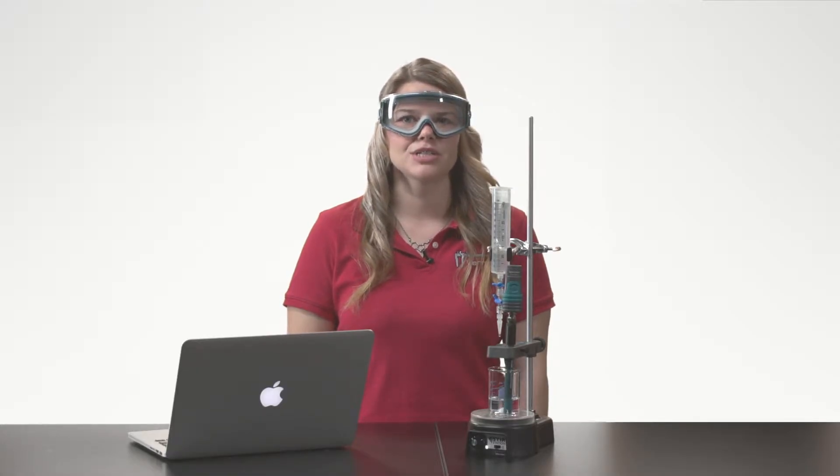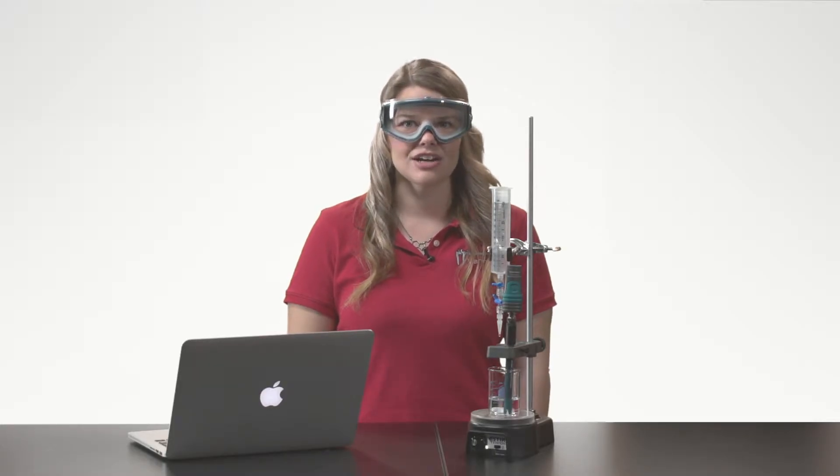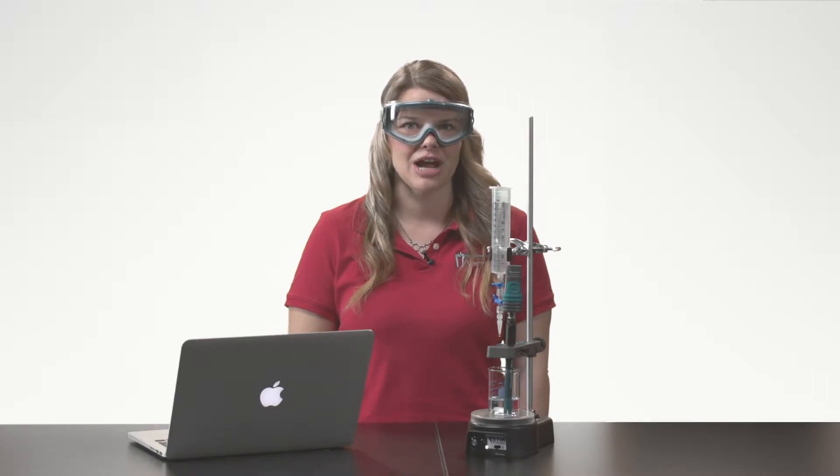In this experiment, you will titrate hydrochloric acid with a basic sodium hydroxide solution. To get started, I want to make sure I have assembled my titration apparatus.